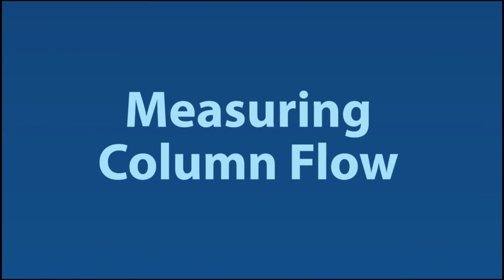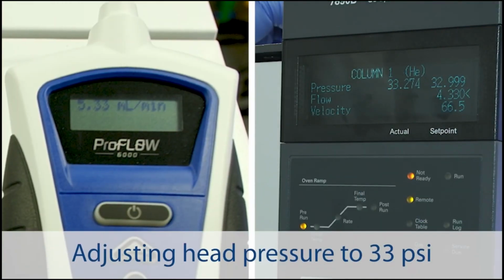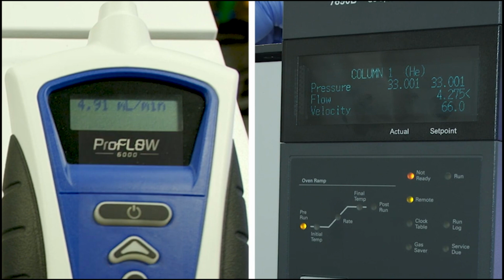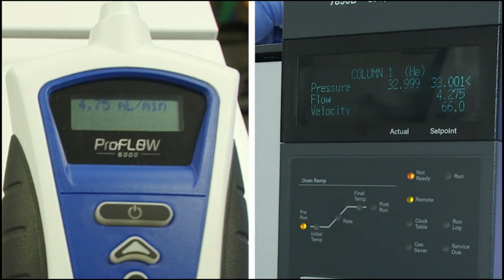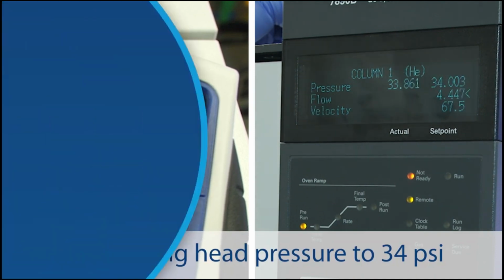So, what are some specific applications for an electronic flow meter? Measuring column flow. Starting with the column, a great use for a flow meter is measuring column flow. While this can be an excellent troubleshooting step for all columns, packed and micropacked columns stand to benefit the most due to pressure drop variations.